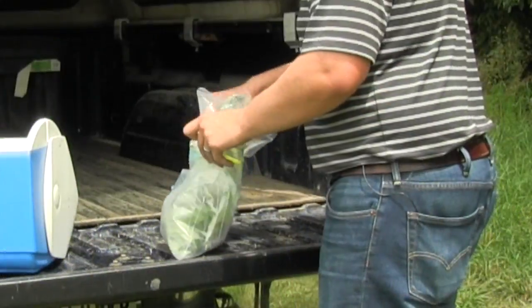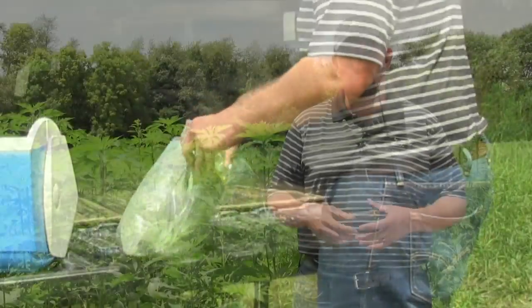We'd like you to ship the samples within one to two days of collecting them. Place them all into one outer baggie along with the five individual baggies and ship overnight. Ship during the week so we can receive them — if you ship on a Friday overnight, it will sit at the loading dock at Purdue over the weekend, which is not good.